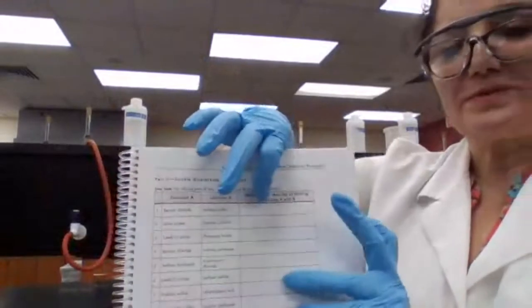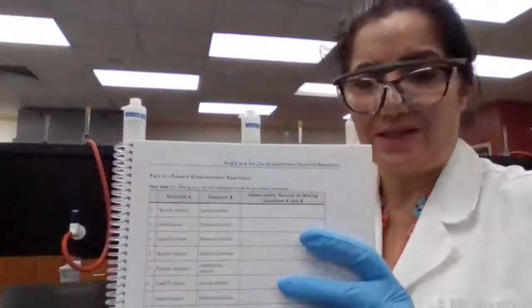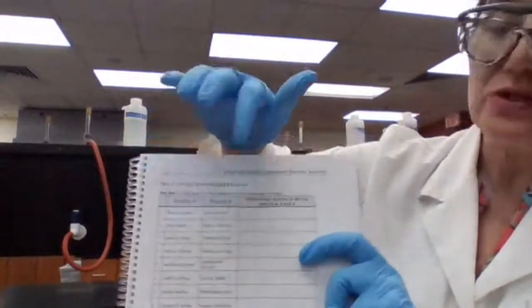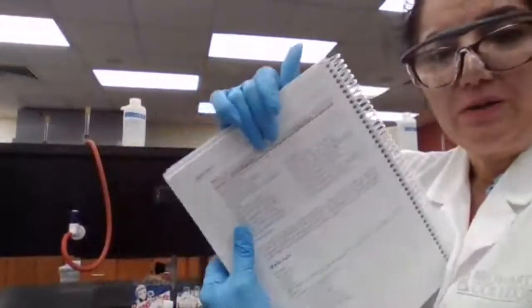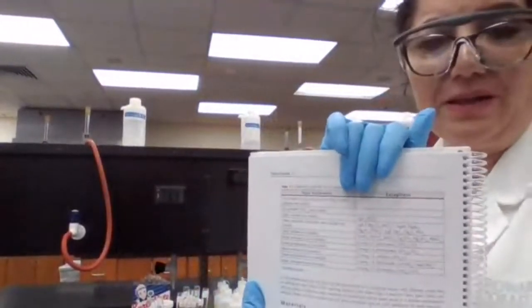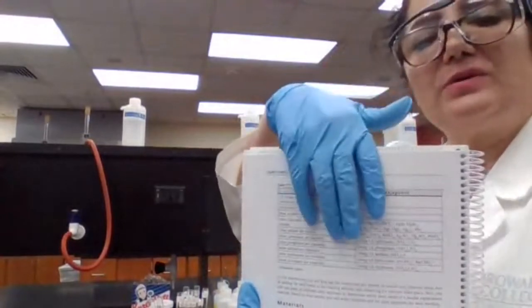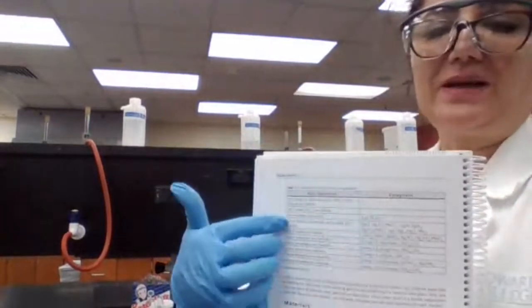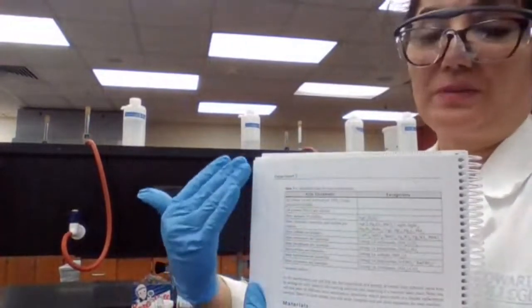So for test tube A, if you see a reaction, the precipitate that forms is not sodium chloride, because sodium chloride, if it forms, is soluble in water. It's going to be the precipitate of barium sulfate that is forming. Whenever you have a precipitate, you are going to use your solubility chart to identify it, because this chart says what combinations are going to be soluble.